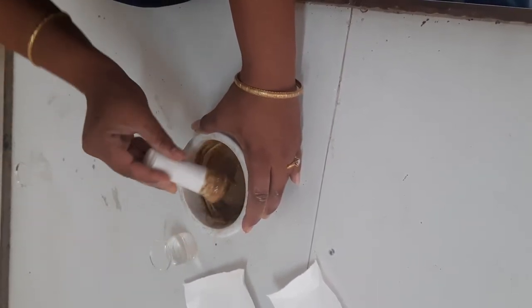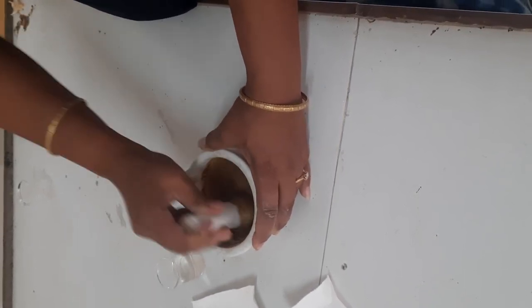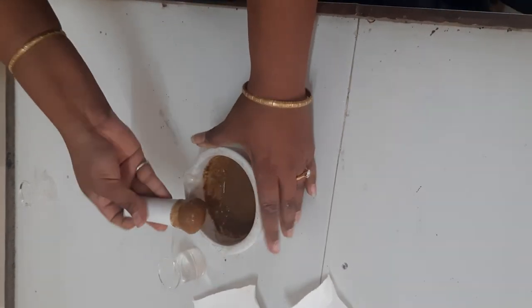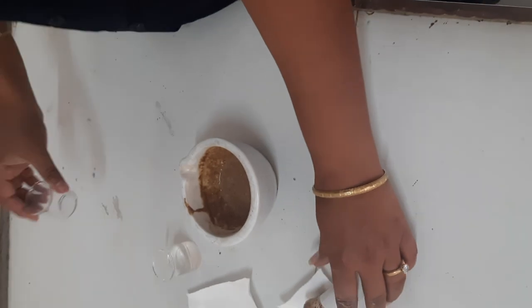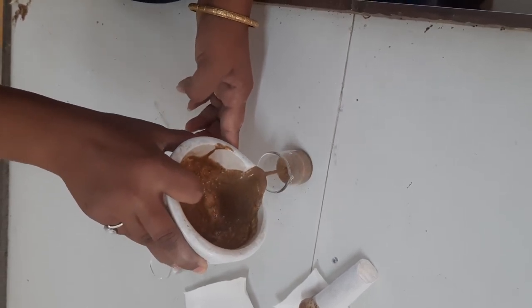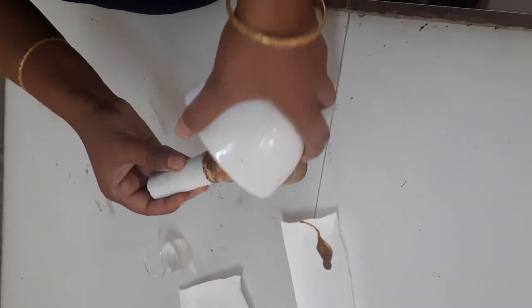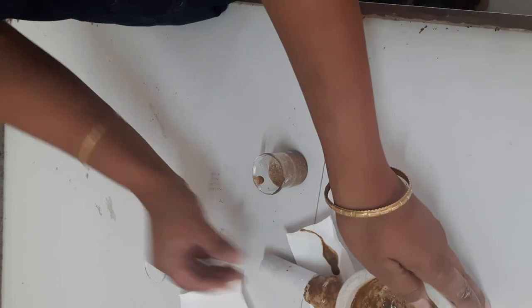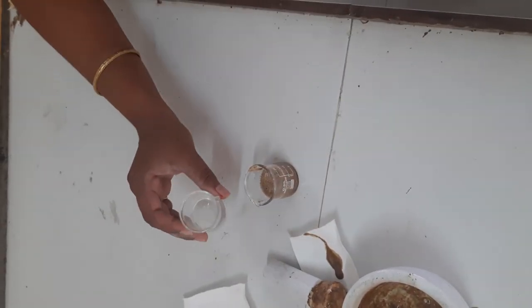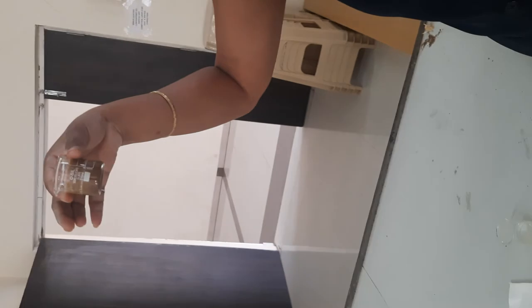Proper trituration is a very important step in the preparation of shampoo. Now you can see it is completely mixed and it has obtained the consistency of shampoo. The next step is to pour this shampoo into the beaker and adjust the volume up to 20 ml. So I am adding some water to make up the volume. Our shampoo is ready now. If you are going to pack it in a container you have to shake it so it will get uniformly dispersed throughout.